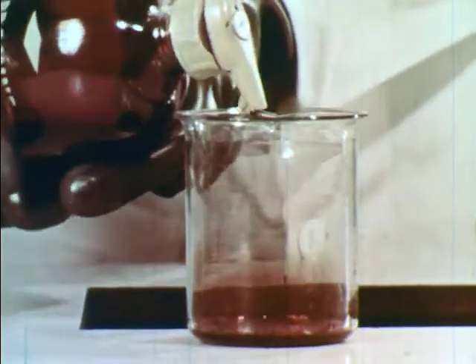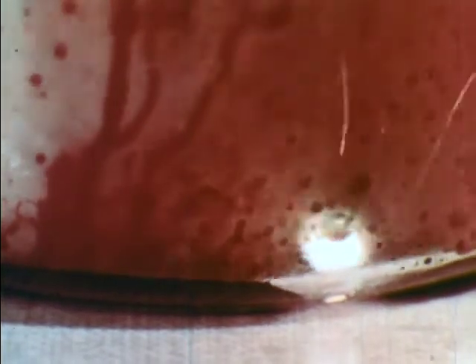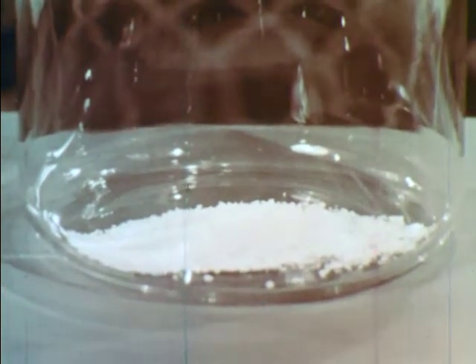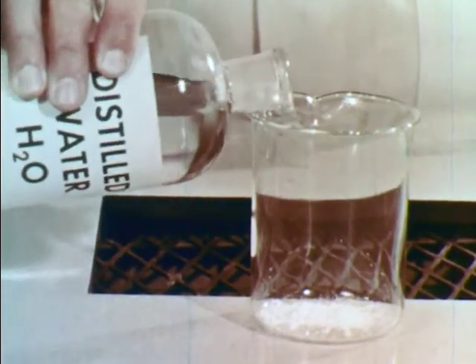Now to another sample of bromine — let's add aluminum. Not much happens at first, but once the oxide coating on the aluminum is penetrated, a vigorous reaction takes place. Similar experiments would show that bromine reacts with most of the other elements. The aluminum and bromine combine to form aluminum bromide, which when purified gives this solid. When water is added, a vigorous reaction occurs as the aluminum bromide dissolves.